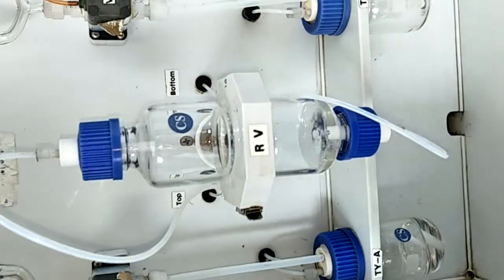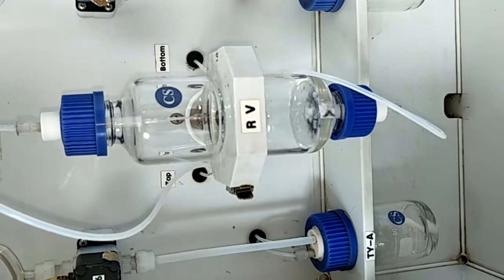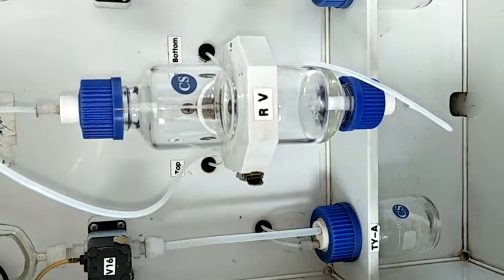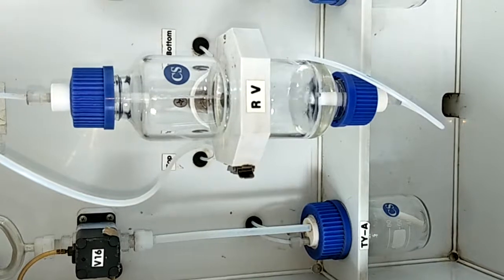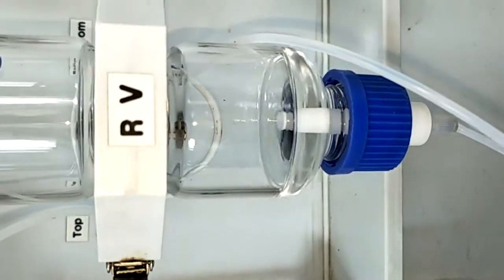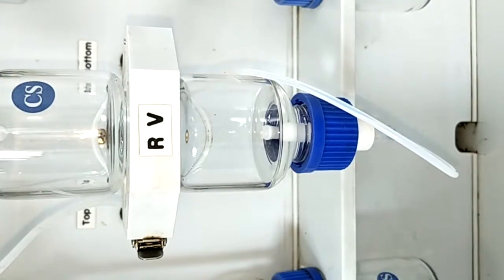And you can see the volume of the transfer being reduced, and also the volume in the RV, what we require, is not proper. This is reducing again, further reducing. You can see that the solvent is reducing automatically, the volume is reducing.